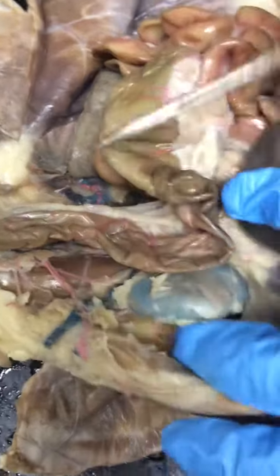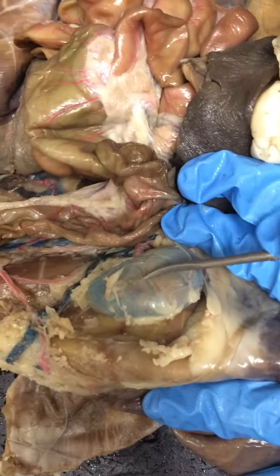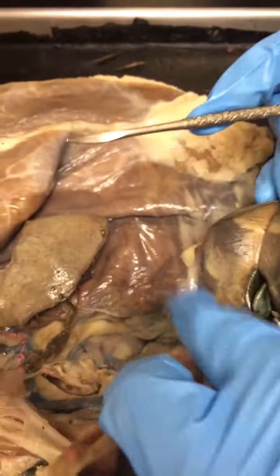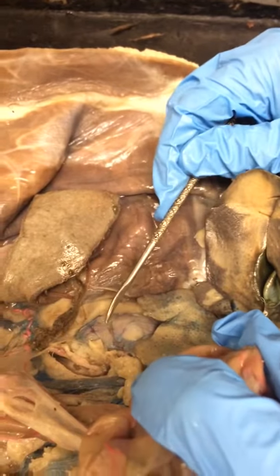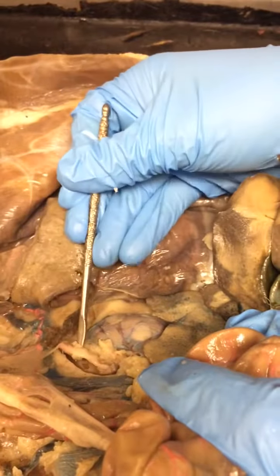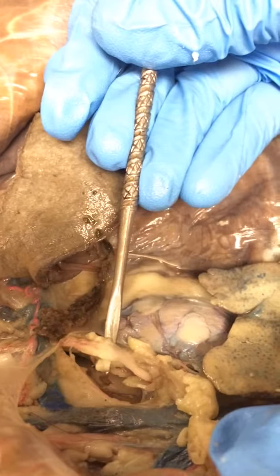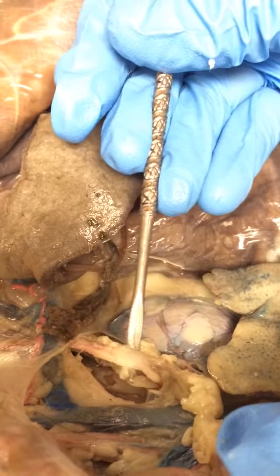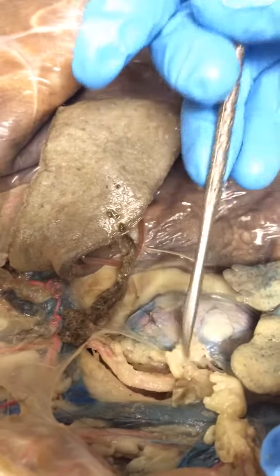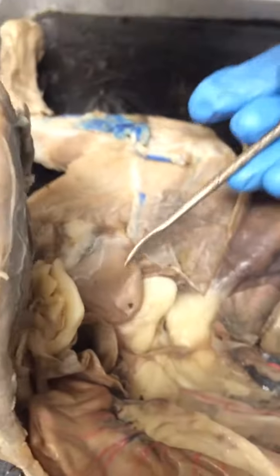Anything more to identify? Okay. So right here, you can actually see this really well. This is one of your kidneys. All right. So this is one kidney. If we peel this back, here's a second kidney. Going from the kidneys, you can actually see right here, this is one of the ureters, sorry. So this is a ureter right here. It goes from this pyramid on the kidney and then descends all the way to the bladder right here. So this is your bladder, okay?